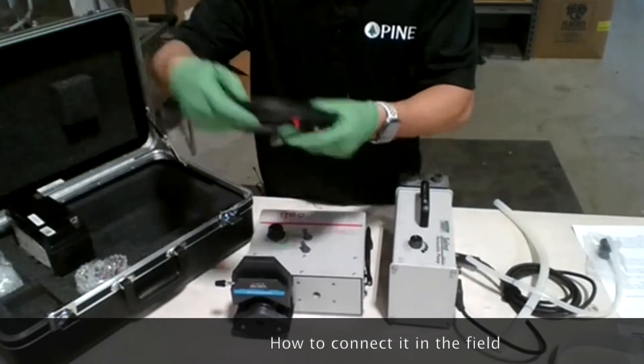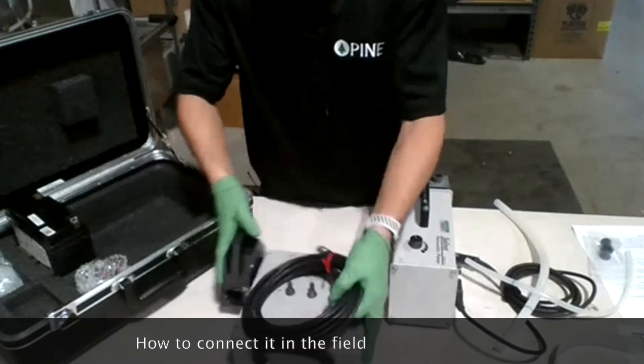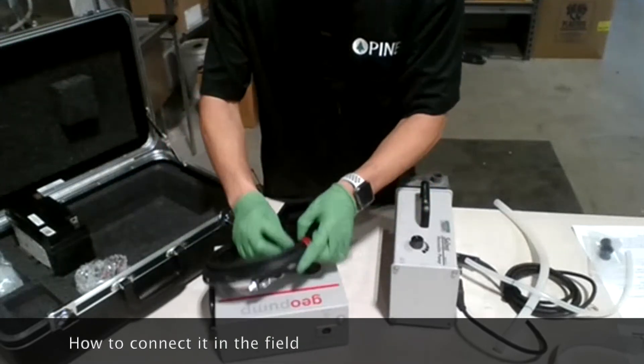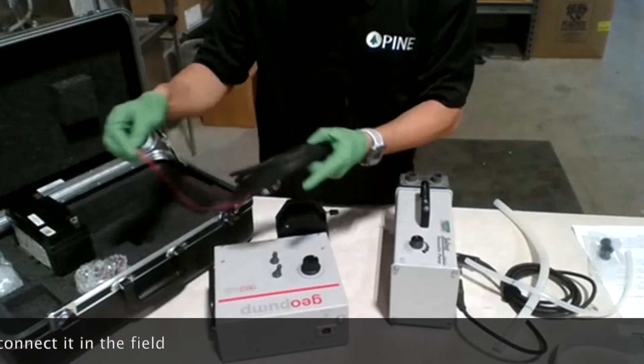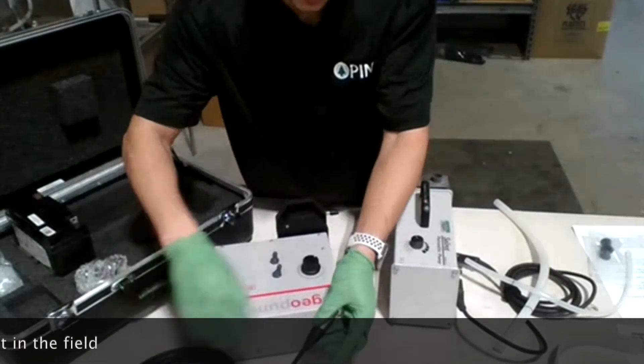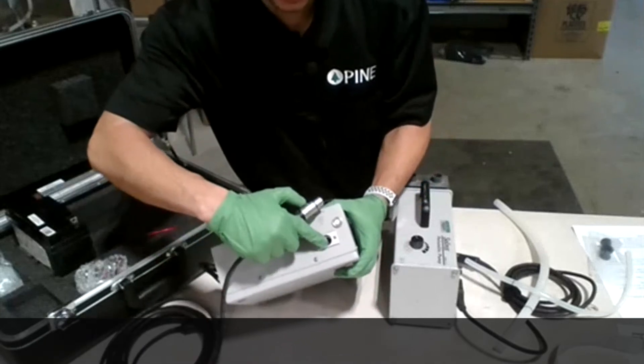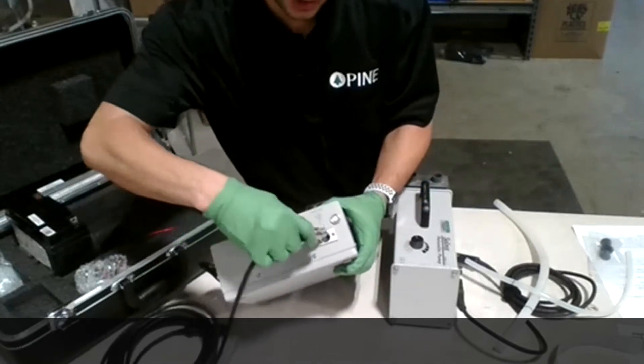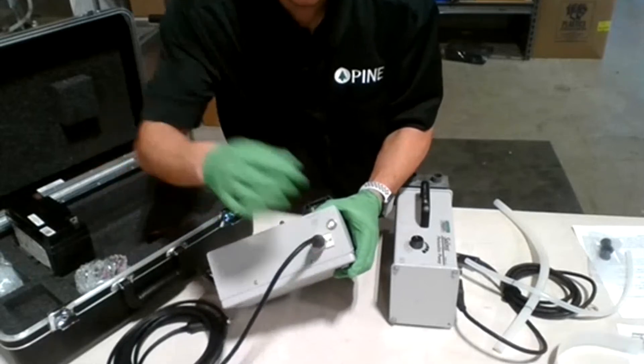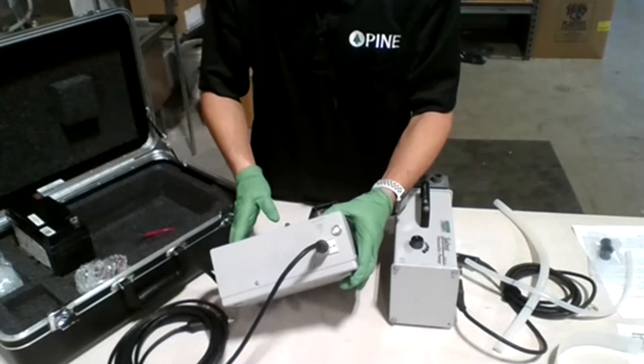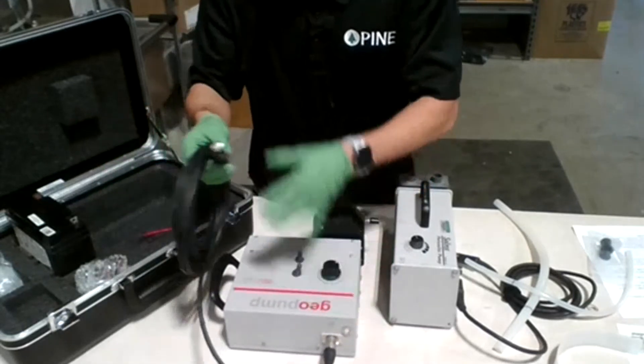This is the cable that comes with the unit. The cable is at the back here. You can just plug it in. I'm going to untie this. You can simply plug it in here at the back. You can see there's a groove here - you just match it with this one and simply push it in until it locks in place. Now the unit is plugged.